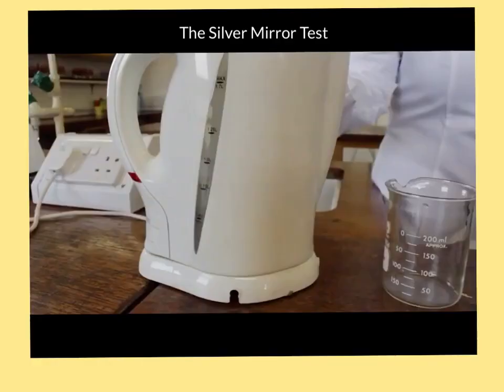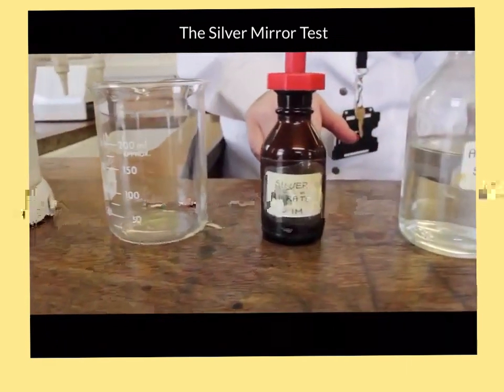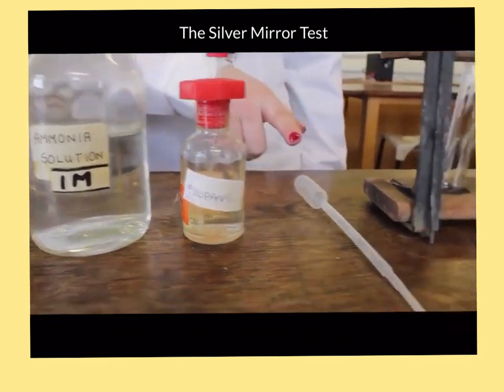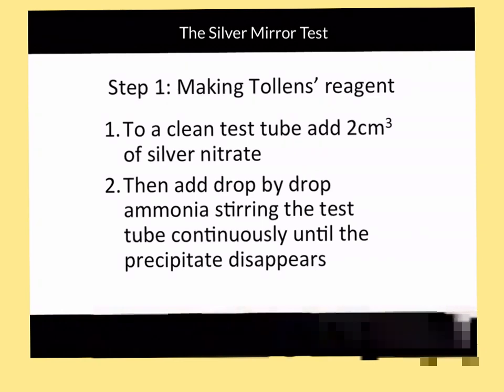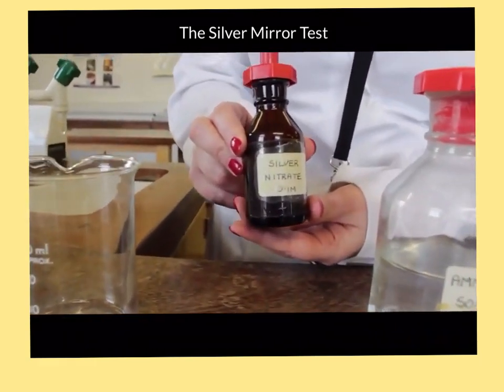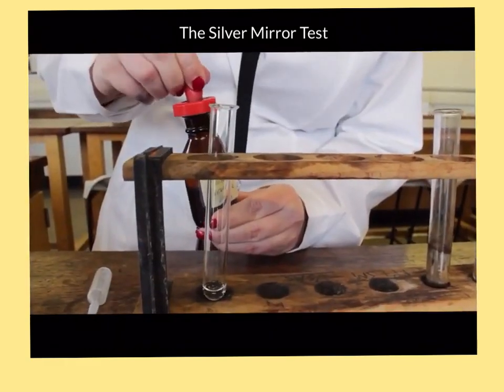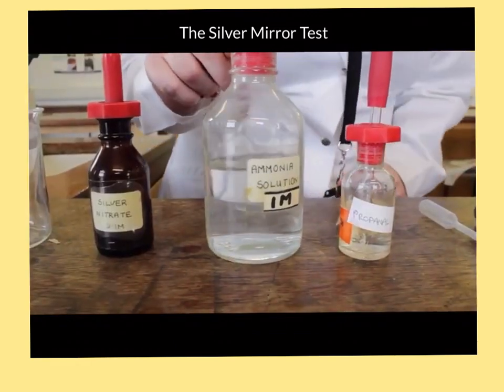A beaker, silver nitrate solution, ammonia, propanal, a pipette and a clean test tube. We start by adding about 2 centimetre cubed of silver nitrate solution to our test tube. We're now going to add the ammonia solution.